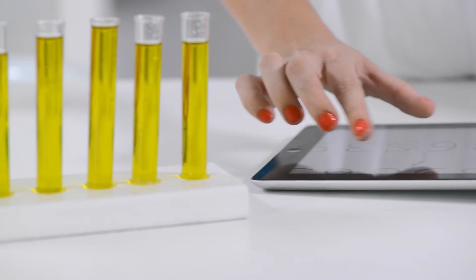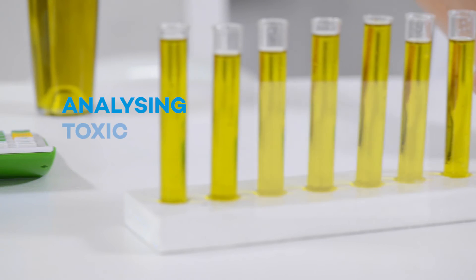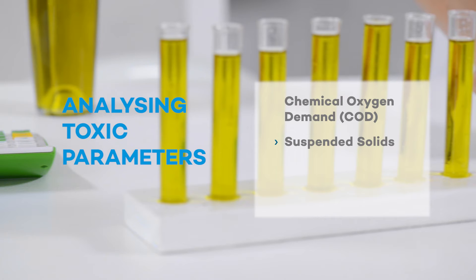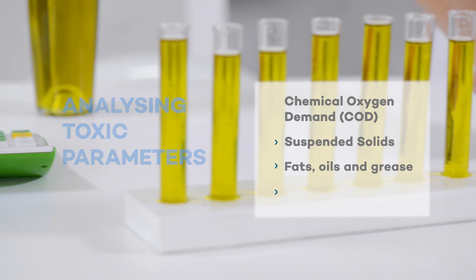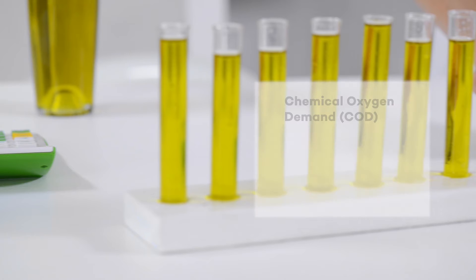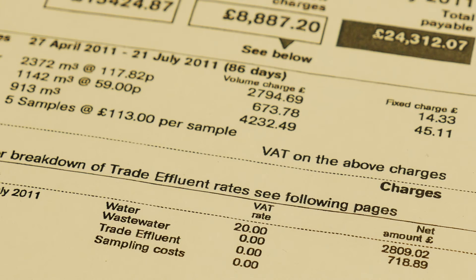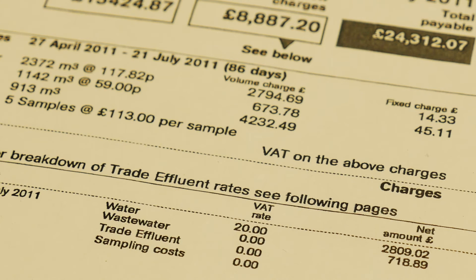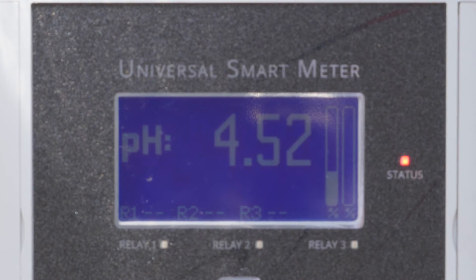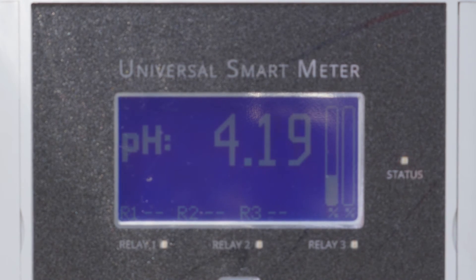Water companies will periodically take away this 24-hour sample and analyze it for the toxic parameters: COD, suspended solids, fats, oils and grease, and any other relevant parameters. Alongside the readings from the flow meter, this information will then be used to calculate your effluent bill. It is also common practice to measure the pH of the effluent at the same time and log this information.